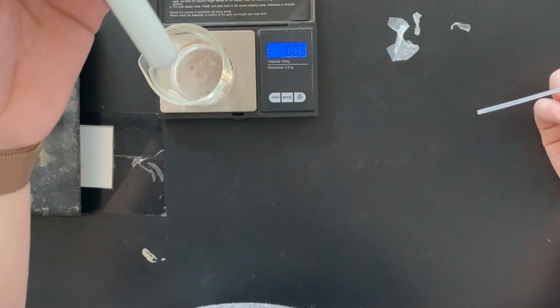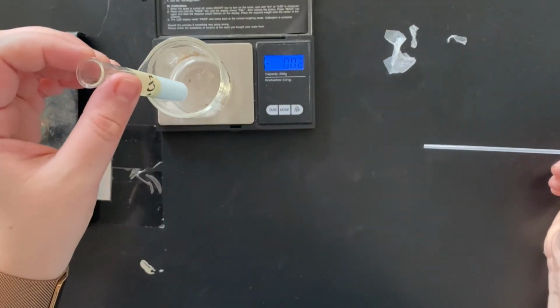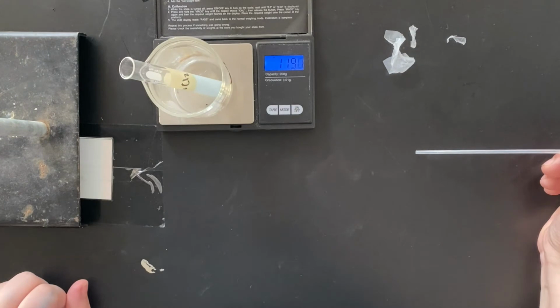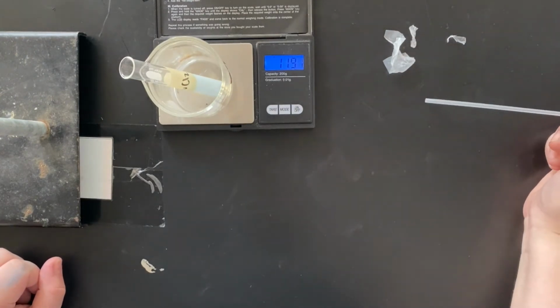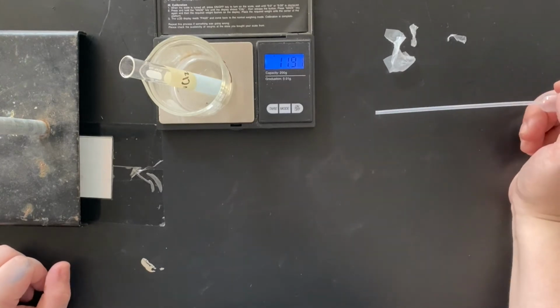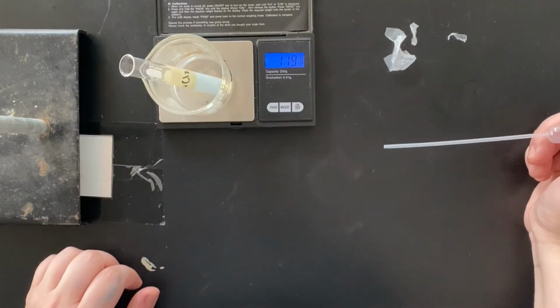Now that the reaction has happened, you have a new object in here. So what you're going to want to do now is take the mass of that. So in your little empty beaker, put that in there, record that mass. This is about 11.91 grams. So once that is there, you are good. You have all the information that you need to collect.